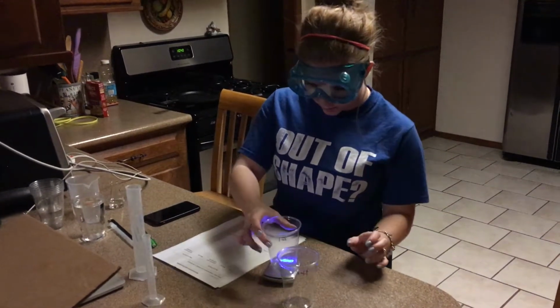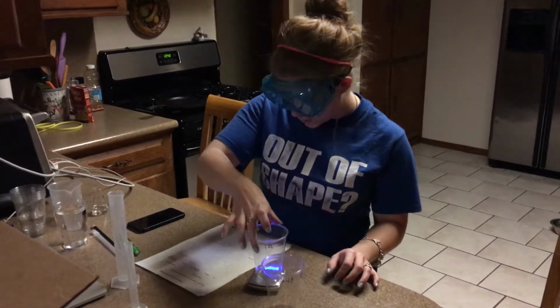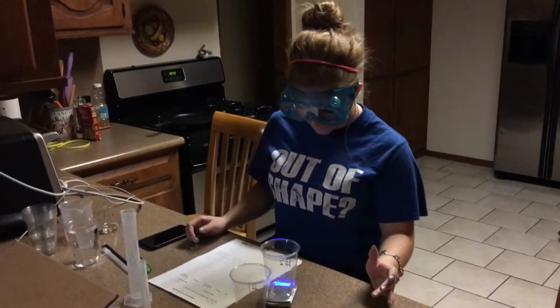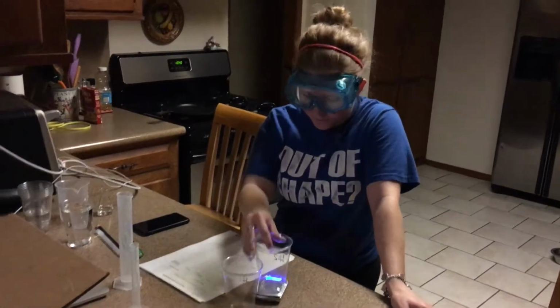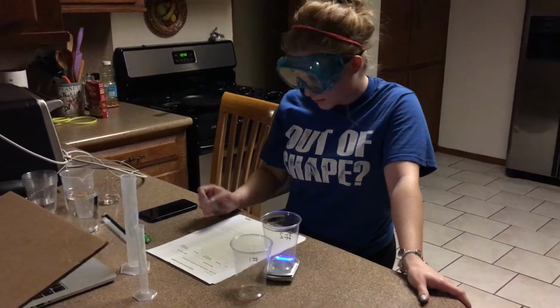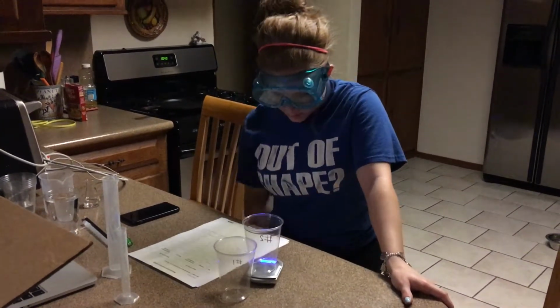So it's going to be the same average over here too. They're all 10.13. Now we'll go to cup 2, and again I get 10.13 every time.